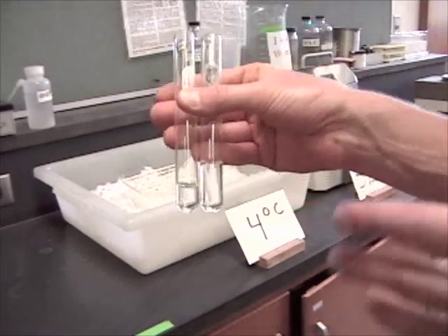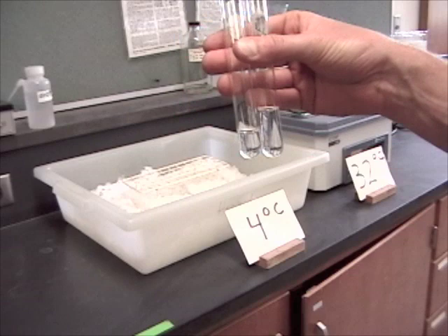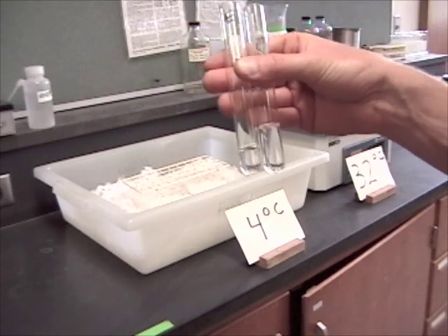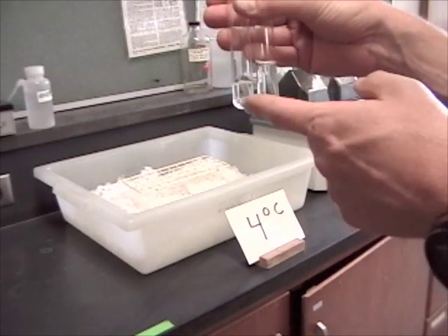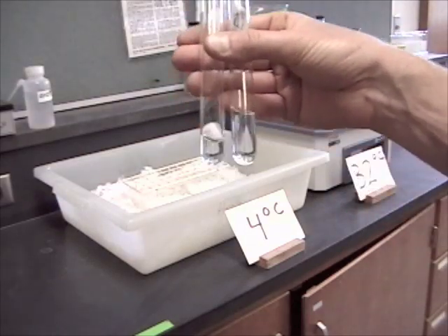Back at my bench, my group and I mixed up our reagents in our labeled tubes. Here I have tube 2 and tube 3 for the temperature experiment, and remember, one of them should have about 3 mils in it, the other one should have about 5 mils. Make sure you look at it and test and make sure you've got the right amount in there.